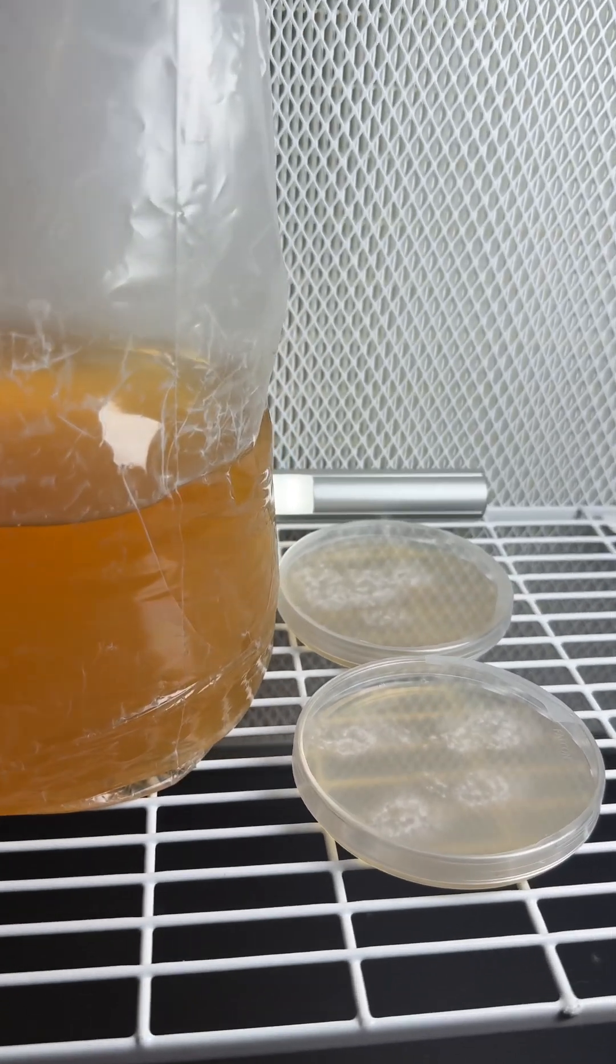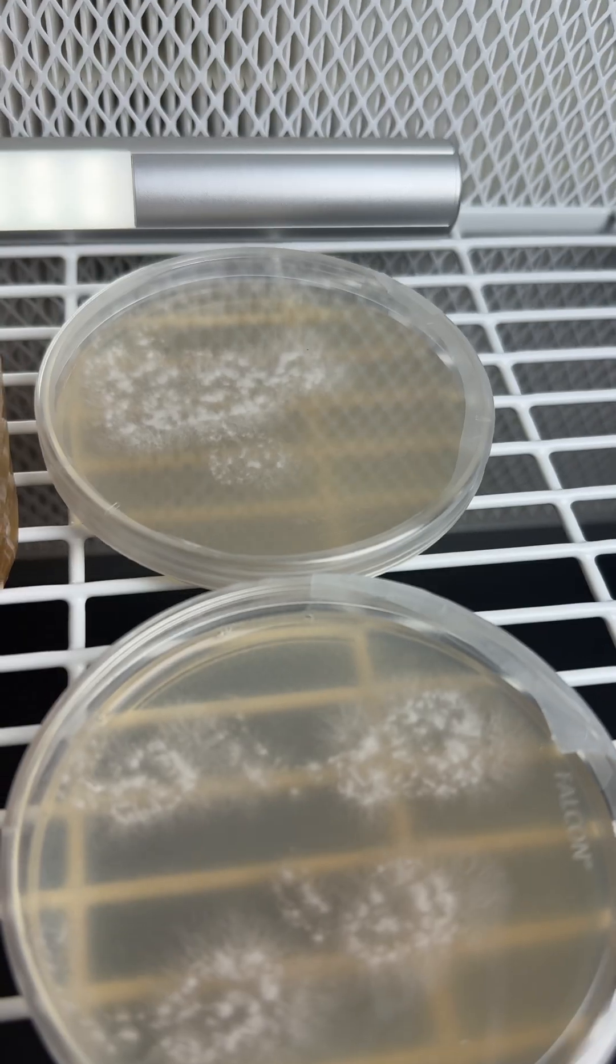The agar plates revealed no contamination, so the bioreactor bag is a success.